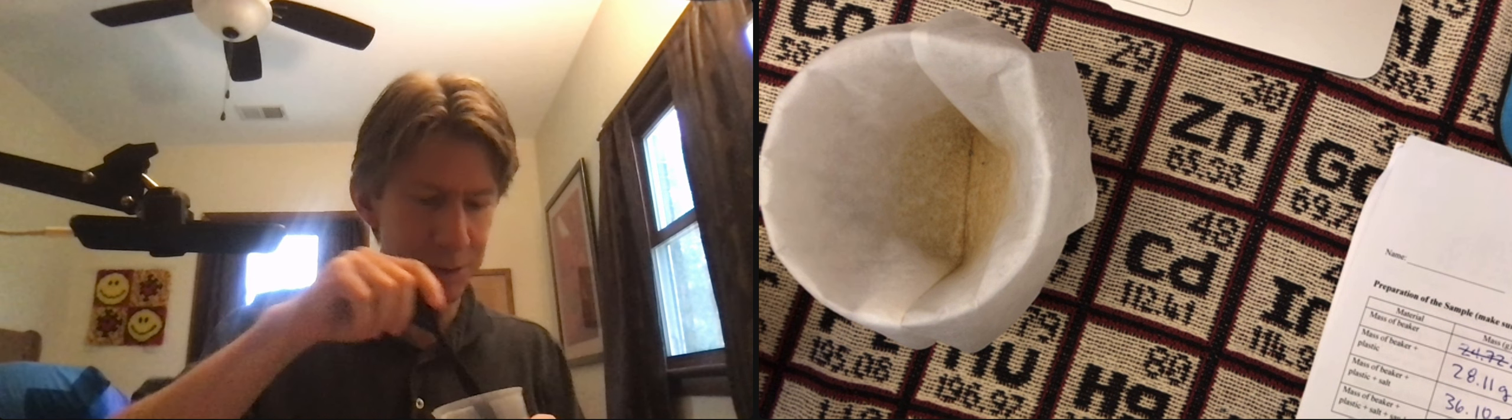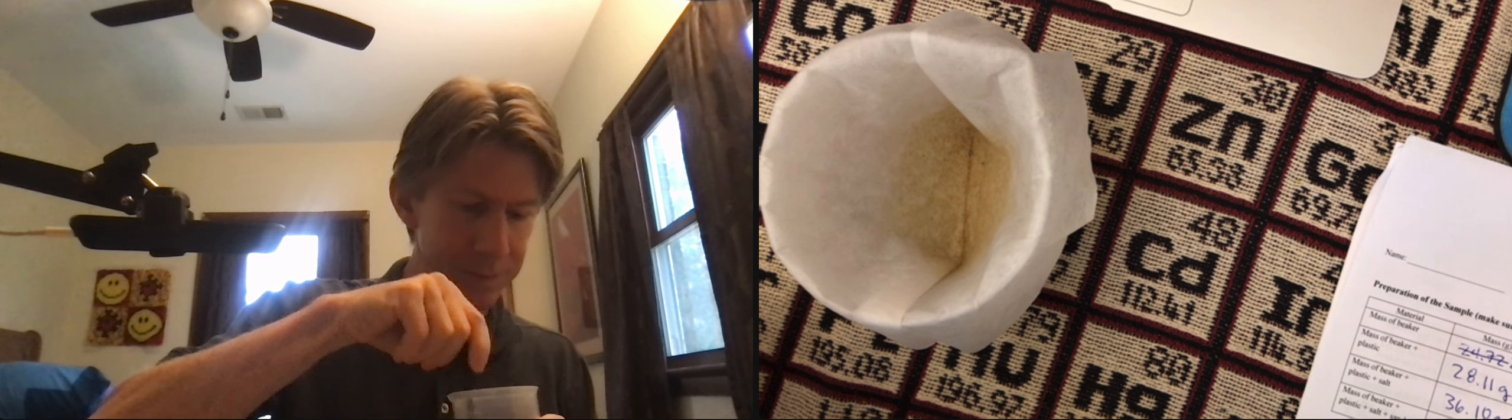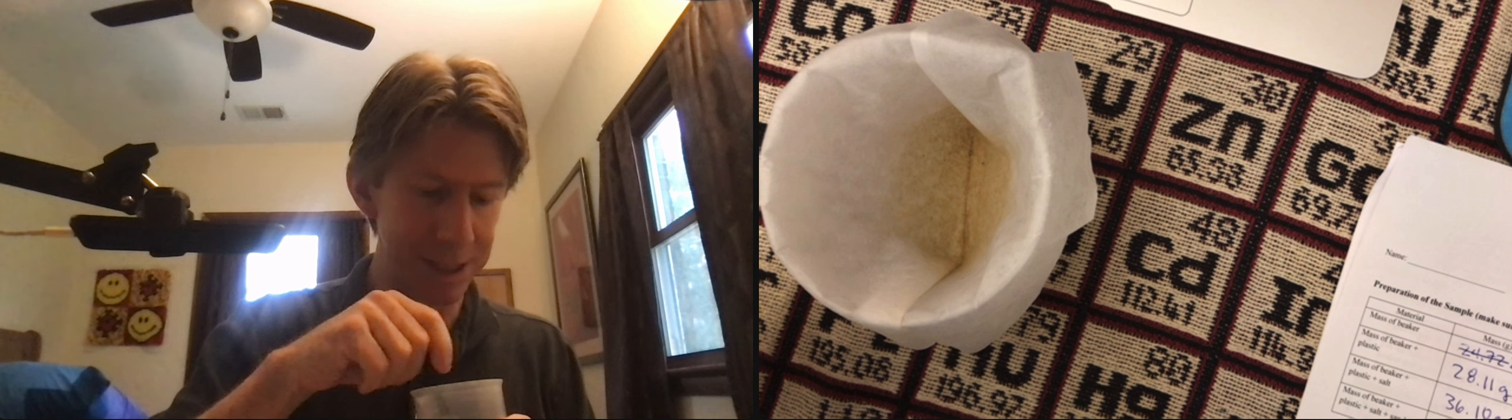And I'm going to use the back end of the spoon to stir it. And really what we're doing right now is we're making sure that all of the salt, the sodium chloride, is dissolved and no longer mixed with that sand.